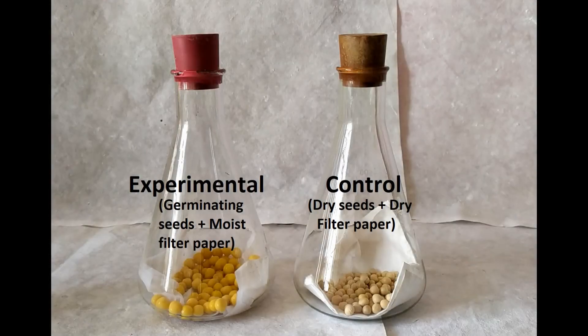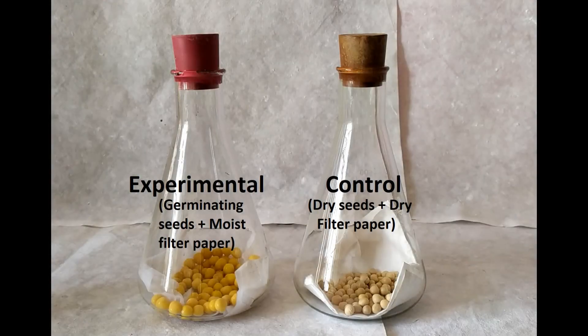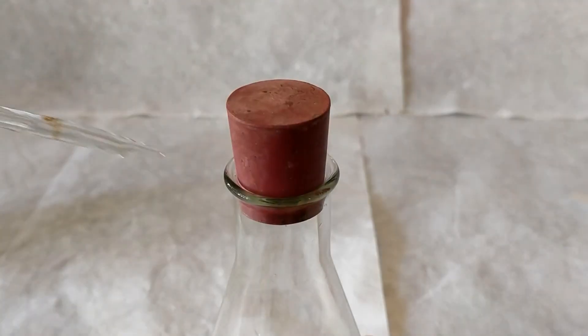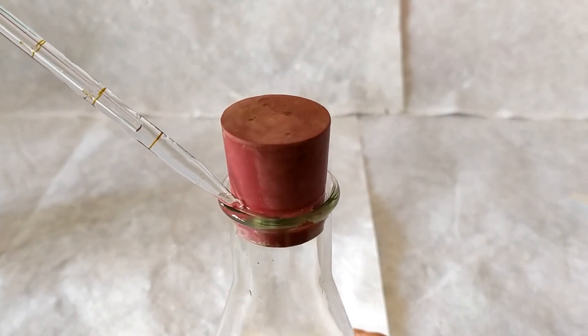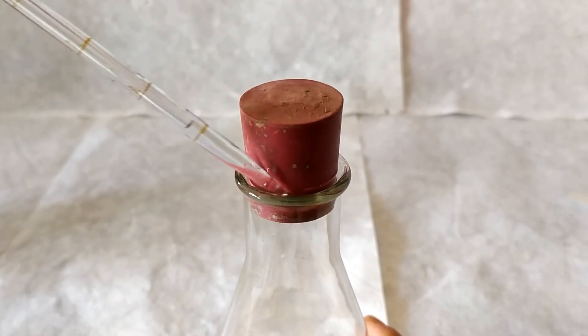The flask containing the dry seeds will be our control for the experiment. Cover both the flasks using the rubber corks and seal the edges with petroleum jelly or glycerol.